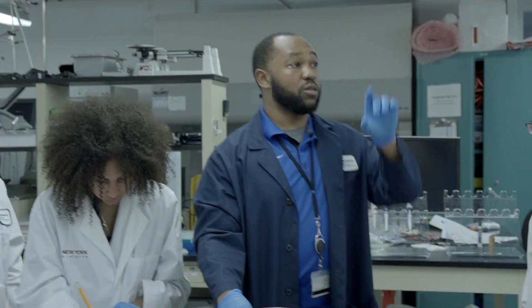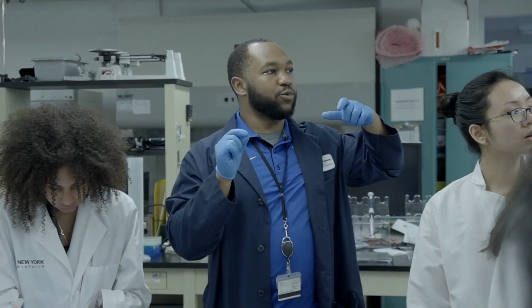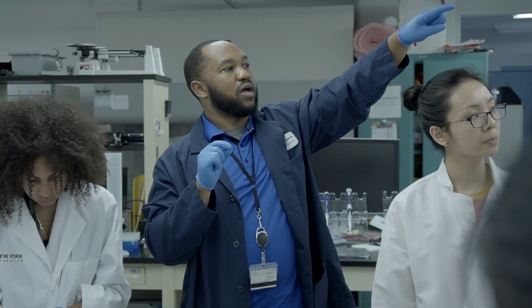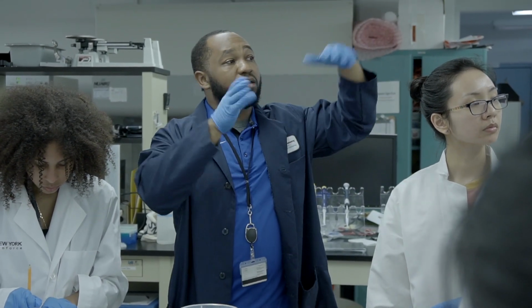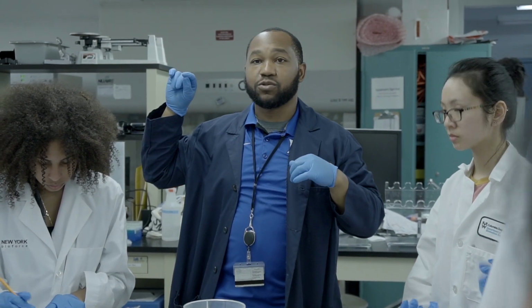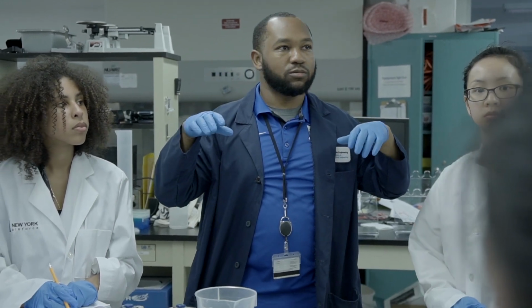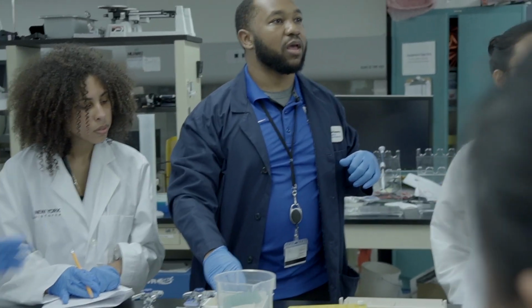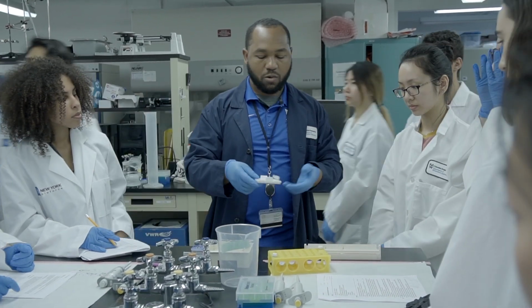Okay. So if you all look on the board, hopefully you remember what your labels were. If you are designated right now in group A, you're going to be doing that here. If you're in group B, you're going to have your PCR and restriction digest samples. Okay? So is this only group A people? Okay, so we can start here while we're waiting.